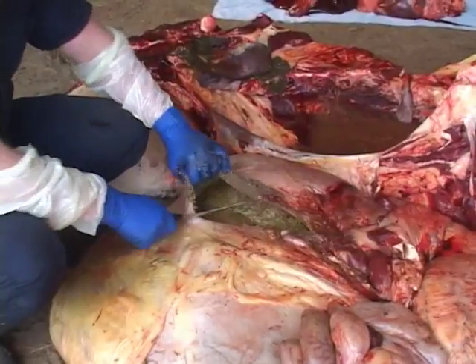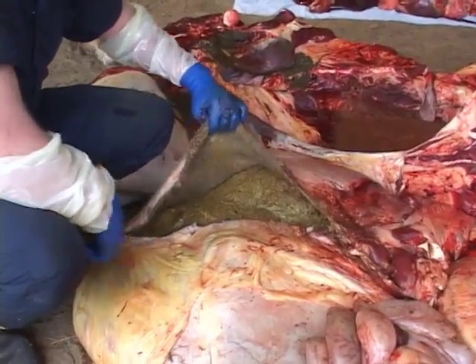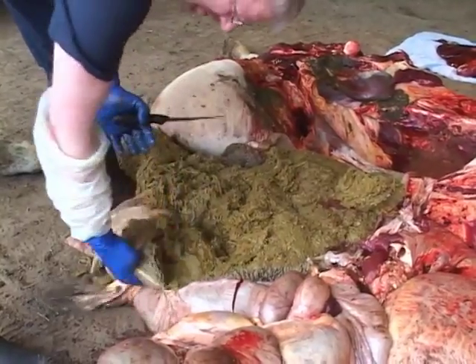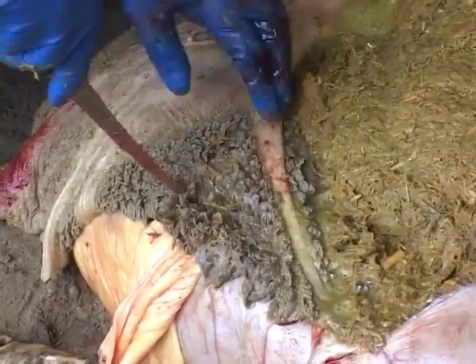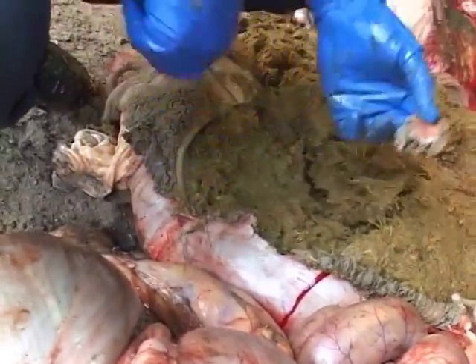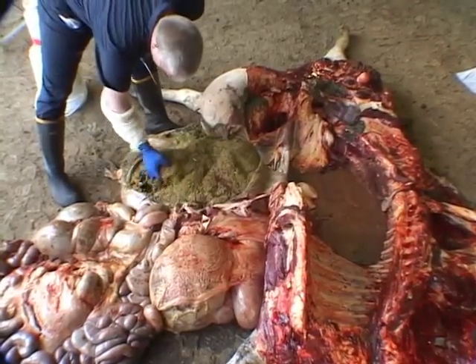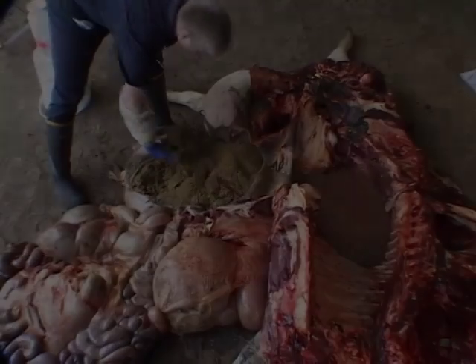Open the rumen and remove some of the contents to allow you to examine the mucosal surface. The mucosa is made up of small papilla. Look for evidence of disease. Cut a small piece of rumen and place it in the jar for histology. Collect some rumen contents and place them in a zipper lock bag for toxicology.